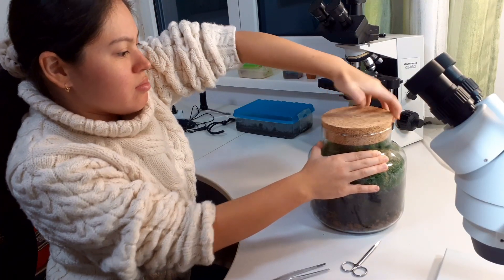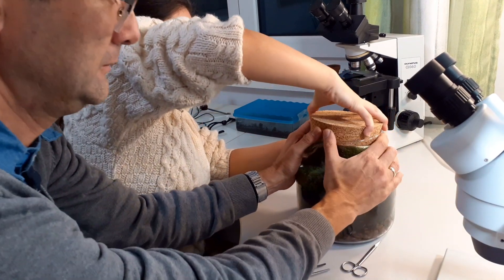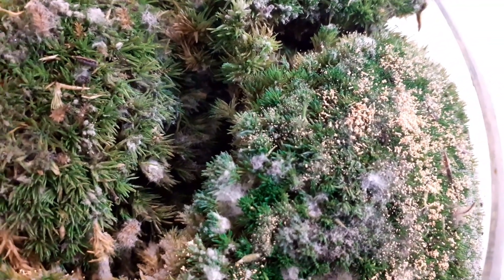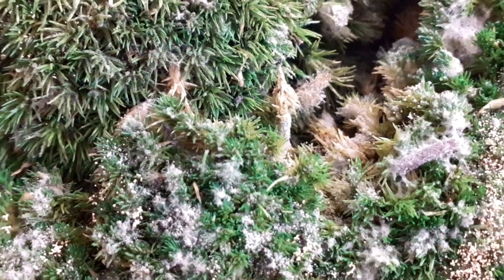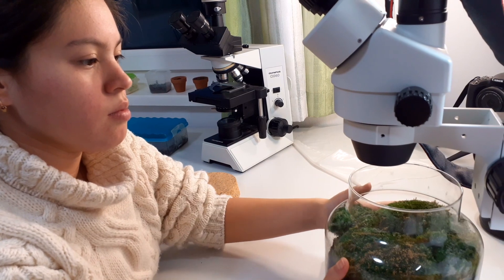The point of a mesocosm is to keep it sealed airtight. But the problem is, of course, getting the lid off. Don't inhale. Everything's covered in fungus, and there are lots of spores in here. Inhaling spores is certainly not something that you want to do — they can cause allergies and they're not healthy. But everything can be put directly under my stereo microscope.